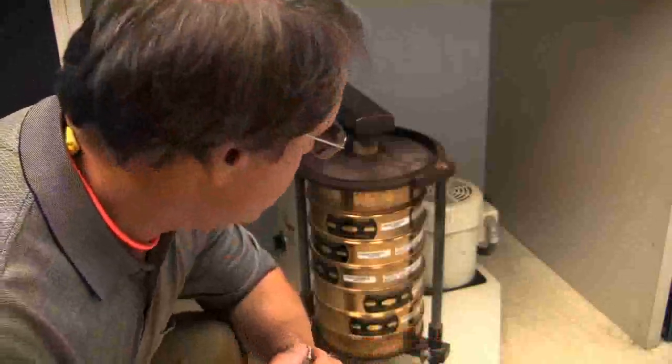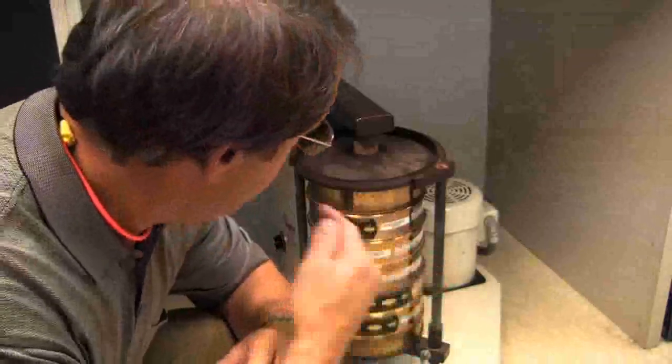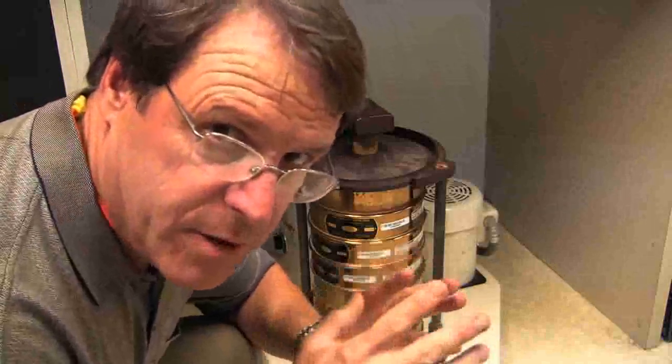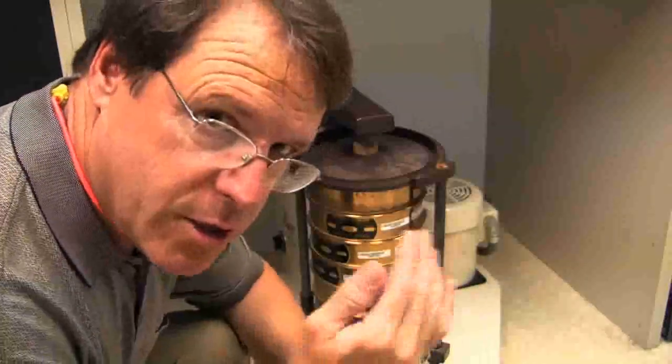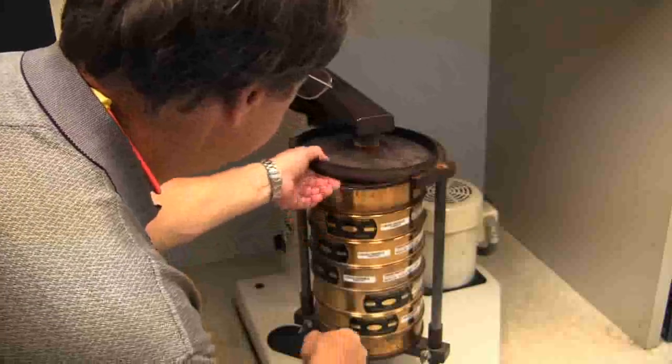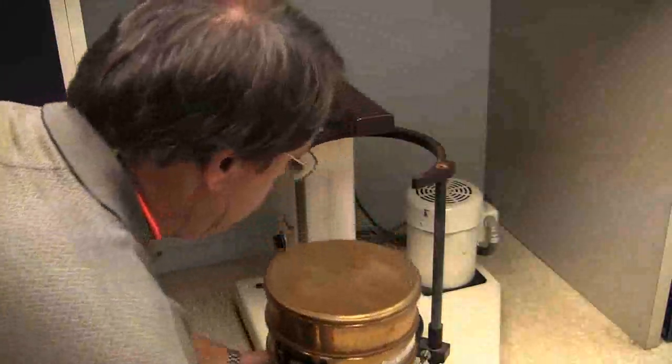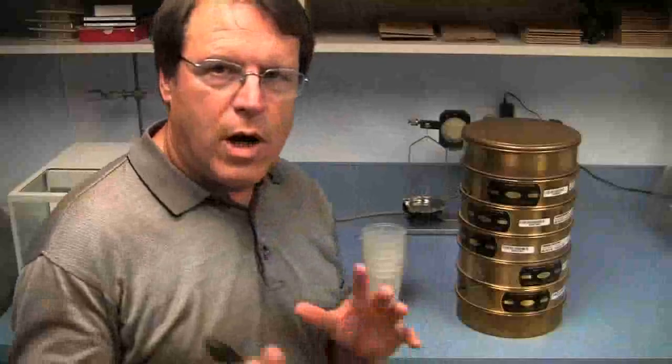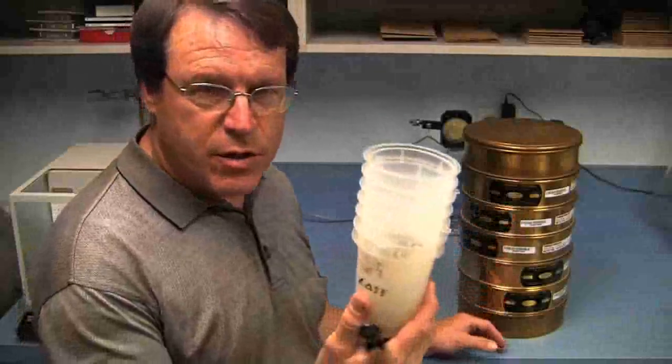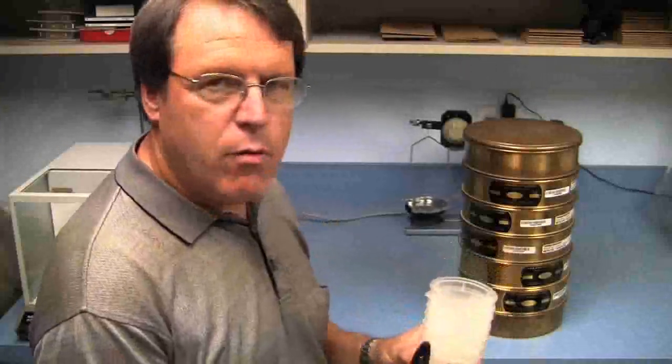Okay, the sieve shaker's done, so now all we've got to do is disassemble the stack, and then we'll collect the sand and weigh each one of the fractions to determine the distribution. What I like to do is just make a quick transfer from the sieves into beakers that make it easier to handle the sands and for the weighing, the final weighing step.